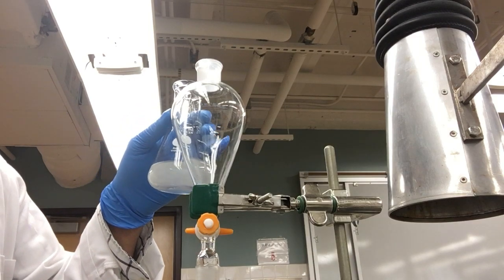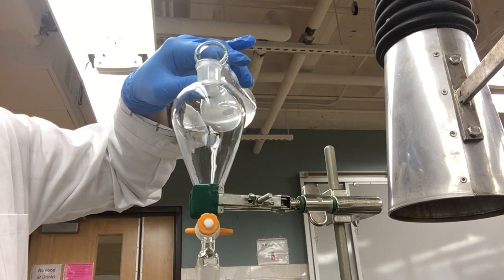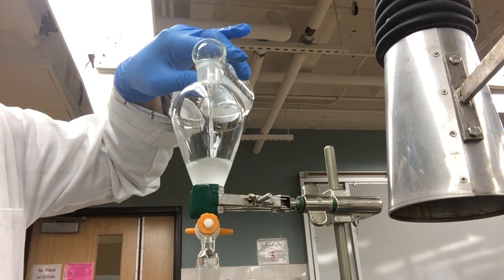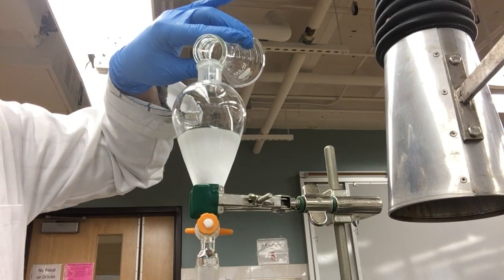We will transfer our mixture to the separatory funnel now very carefully and allow the two components to separate.